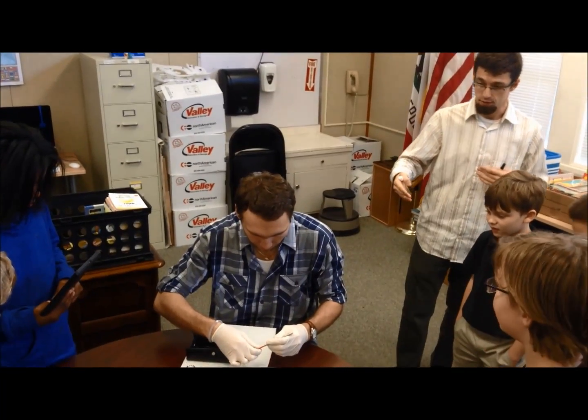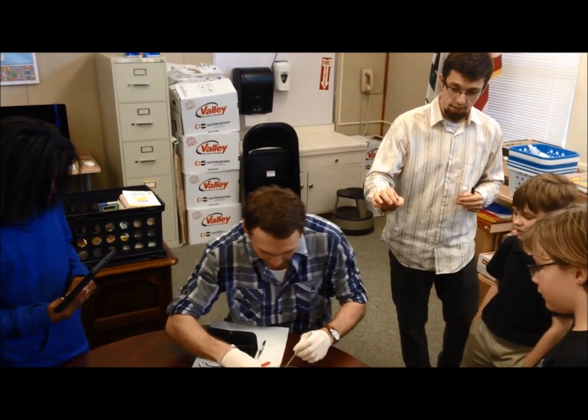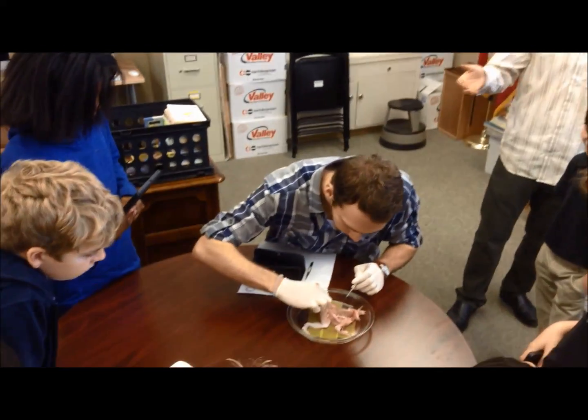So we'll try to expose the nerve, drop a little bit of the calcium on it, and then we'll attach our electrodes and see what happens.